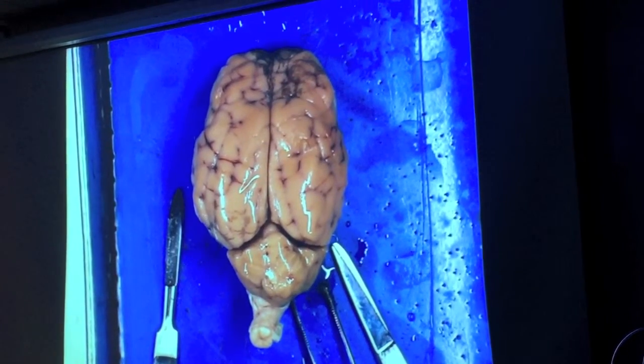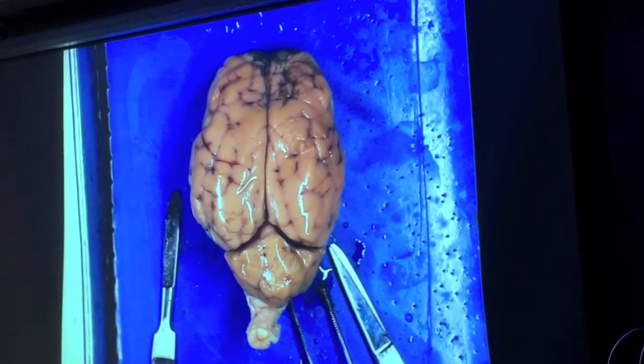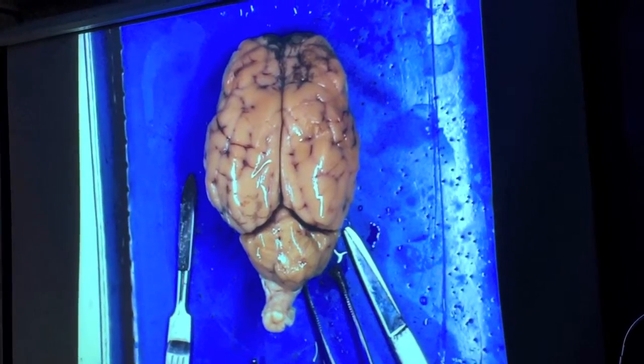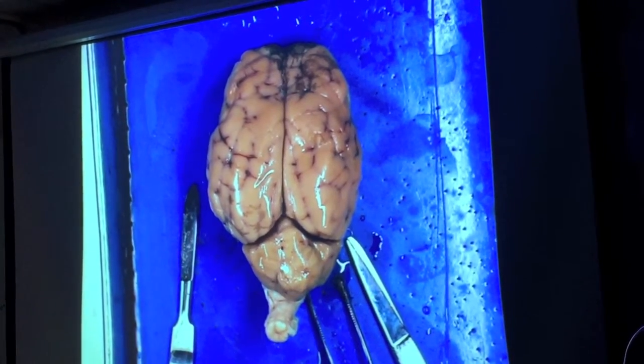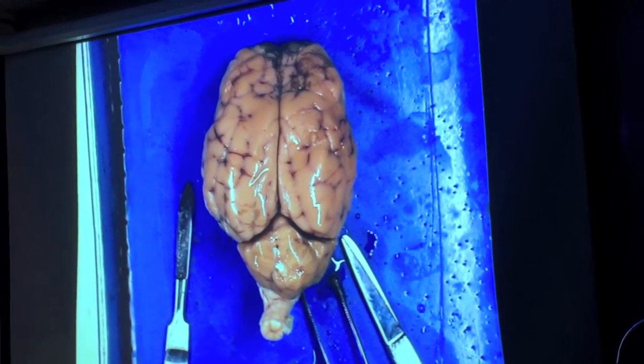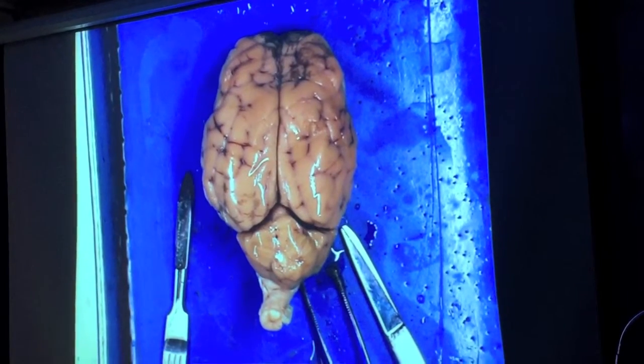These are the parts of the brain that are responsible for sort of the conscious activity, which includes conscious motion. So, anytime you pick something up, your cerebral cortex is part of that process. This is also where the sort of things that we would call personality and thinking would be found. And as you can tell from this, not a lot going on in a sheep, which is not a big surprise.